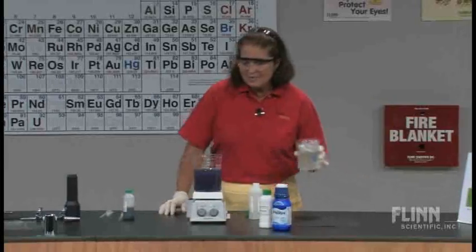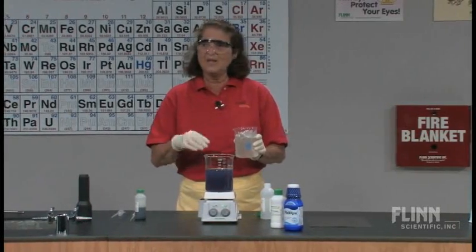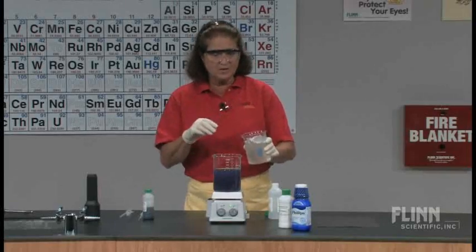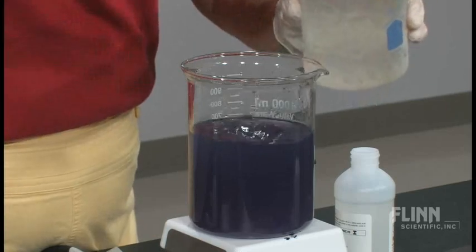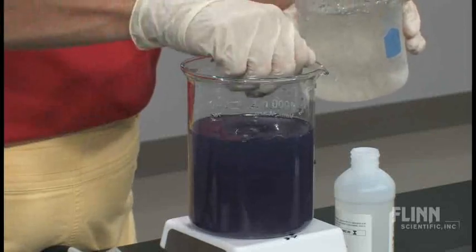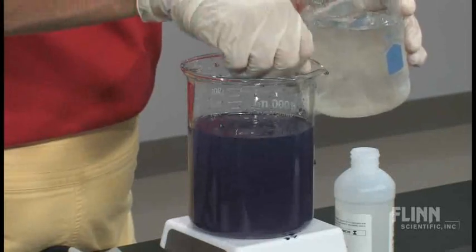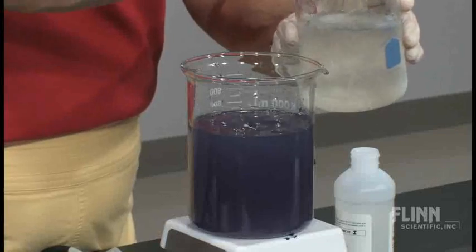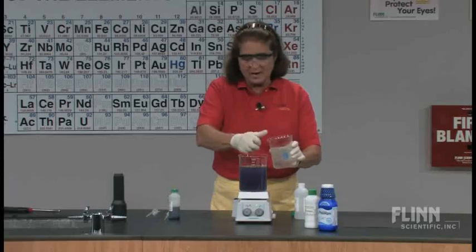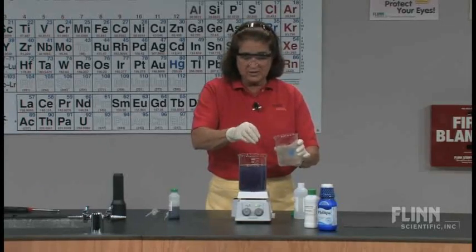We can make this a little bit more interesting by adding some ice. When you first saw the color changes, it was a quick run through the color scale. Let's just put in some ice cubes here. We know that as we cool down a reaction — as we add ice — it's going to slow down the reaction, so we're looking at a little kinetics here.